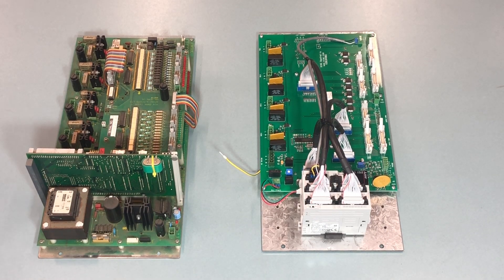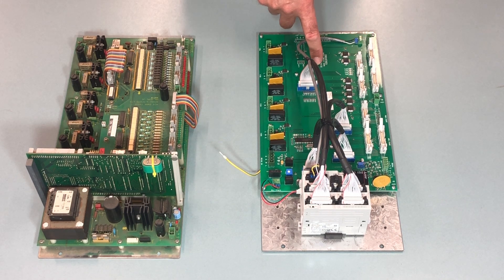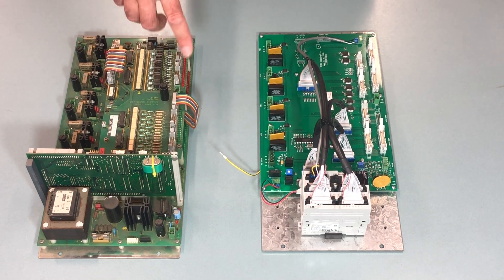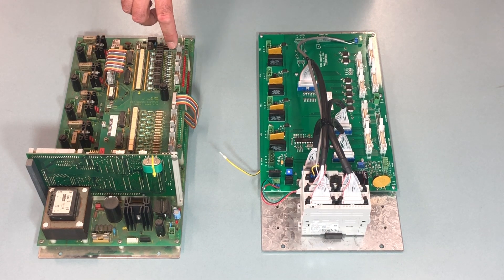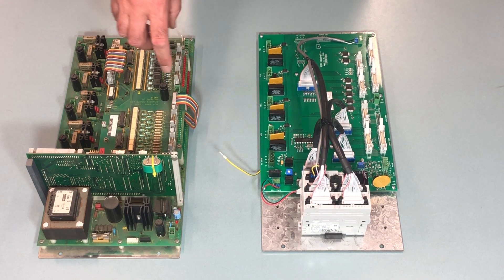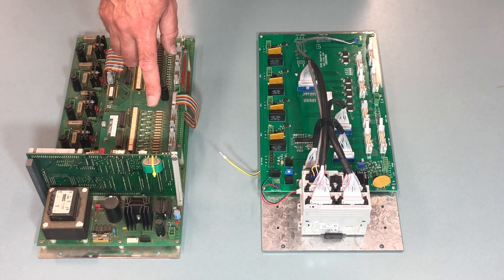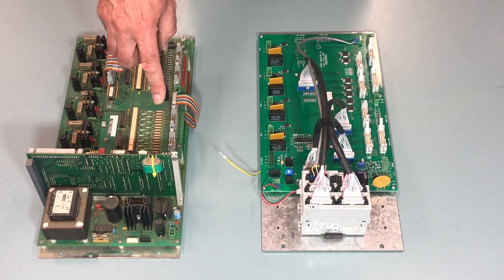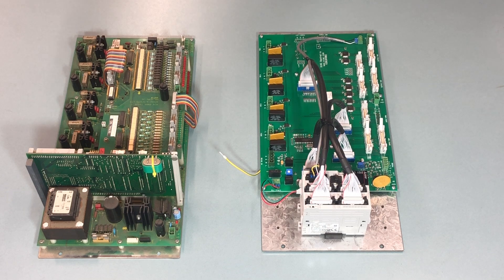The next step is to change the MT4 controller with the new XMT4 controller. Your MT4 controller still has one extra board on the top which is specifically for the EFS head, so that one is not going to be used. It's got some power cables on this side, and then on the other side is a cable that reads the counting signals. That's the board on the top — I'm not talking about that board at the moment.